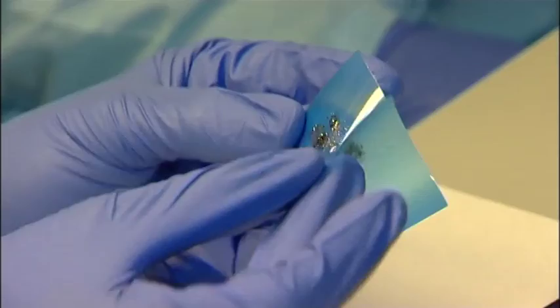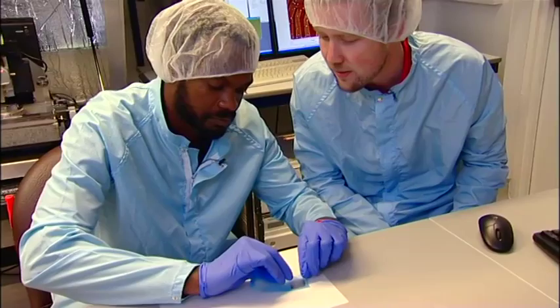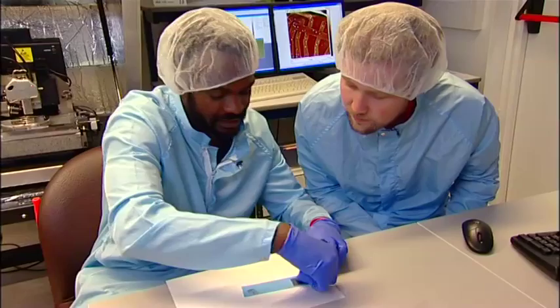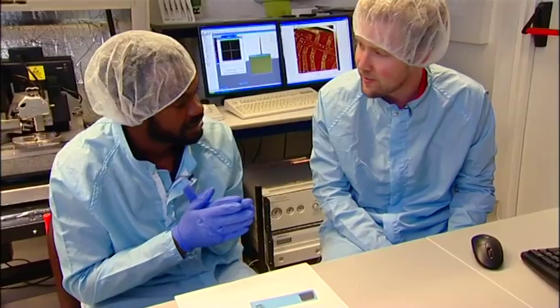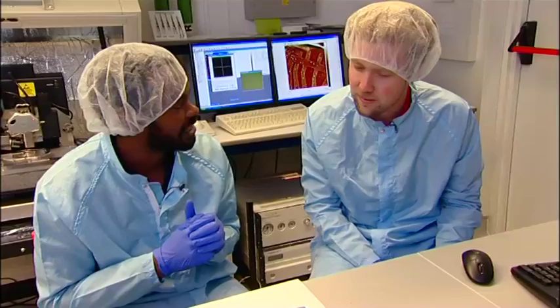What we then do is we have a piece of silicon. So we just put the tape on the silicon like this and give it a nice firm press. What's important is you need the silicon to be really clean, because if the silicon is not clean, the graphene won't stick. We clean it in solvents — acetone, IPA. And then as soon as we have it nice and clean, we press the graphite onto it, so it doesn't have a chance for any hydrocarbons or water to get on the surface. That's why we're wearing all this gear as well — to keep the dirt out, because your fingers are quite oily.